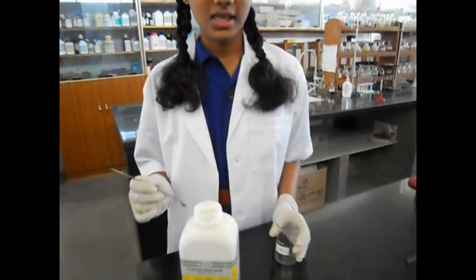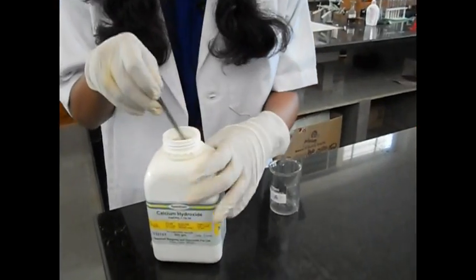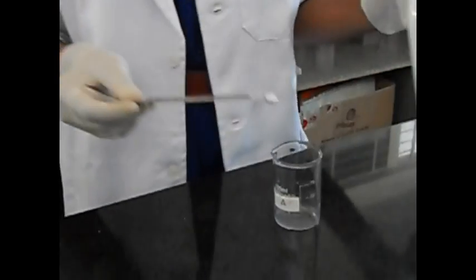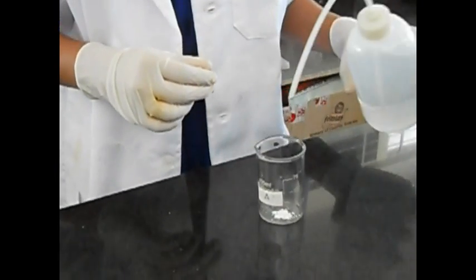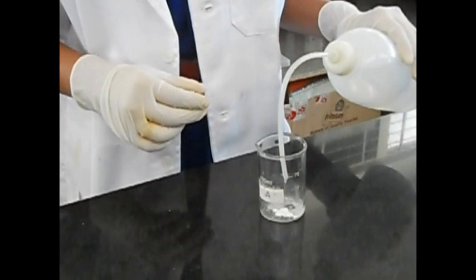Keep it aside while we prepare a solution of calcium hydroxide. Take a beaker and put one spatula of calcium hydroxide into it. Dissolve it using distilled water.